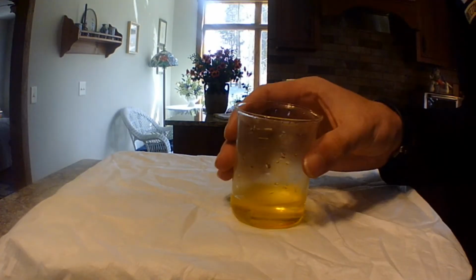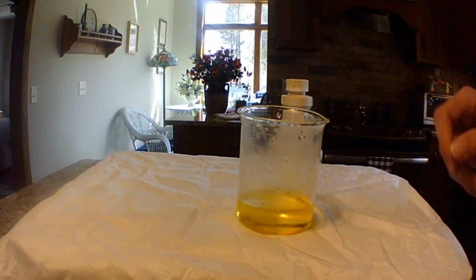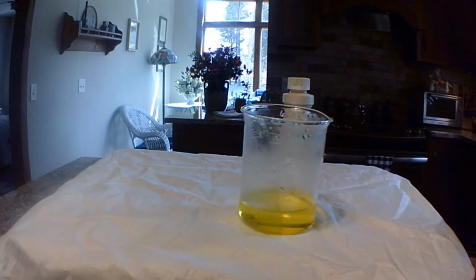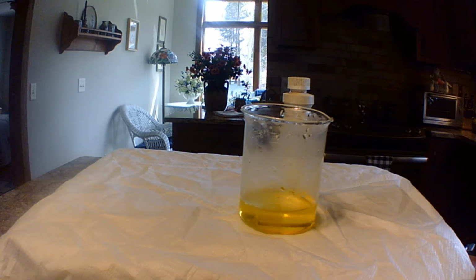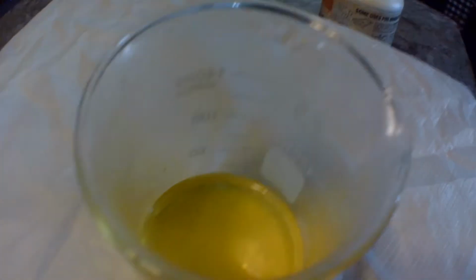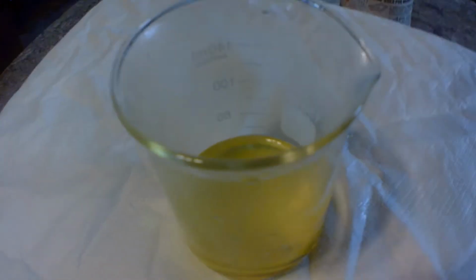So as you can see, the nail, which is the iron, is slowly dissolving and becoming the chlorine iron solution, which will take a while to completely dissolve, but you can really see the bubbles coming off now, which is the hydrogen as it's leaving the chlorine to go onto the iron. So I'm just going to let that sit for a while, and we'll see how dissolved the nail gets later.